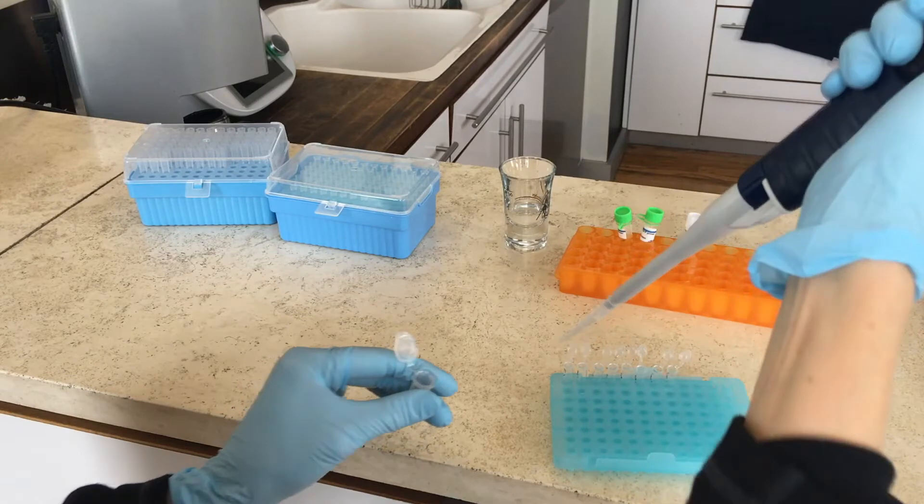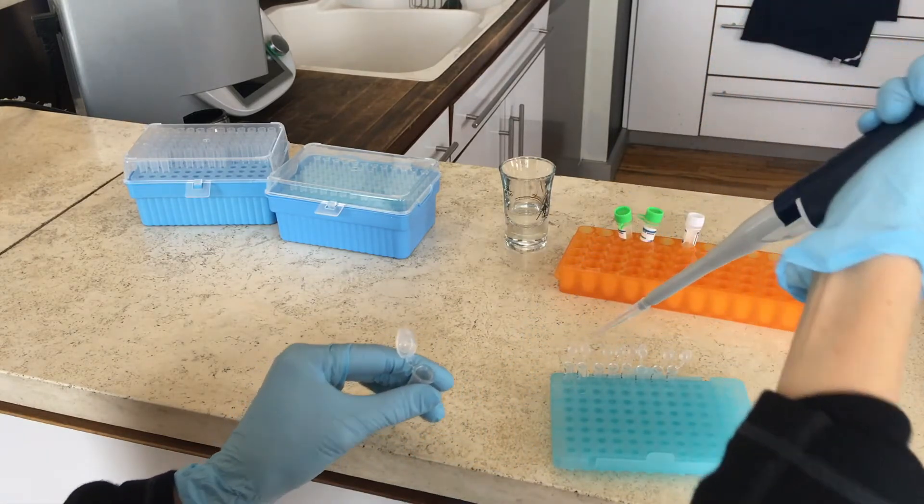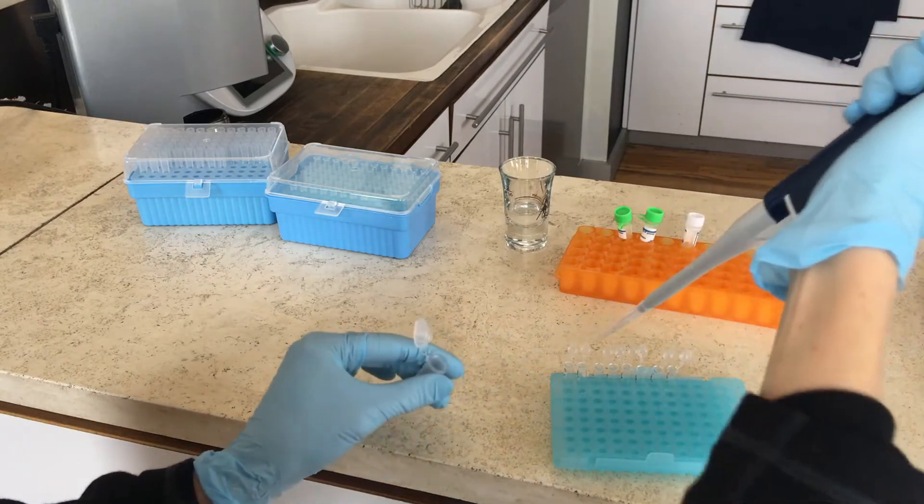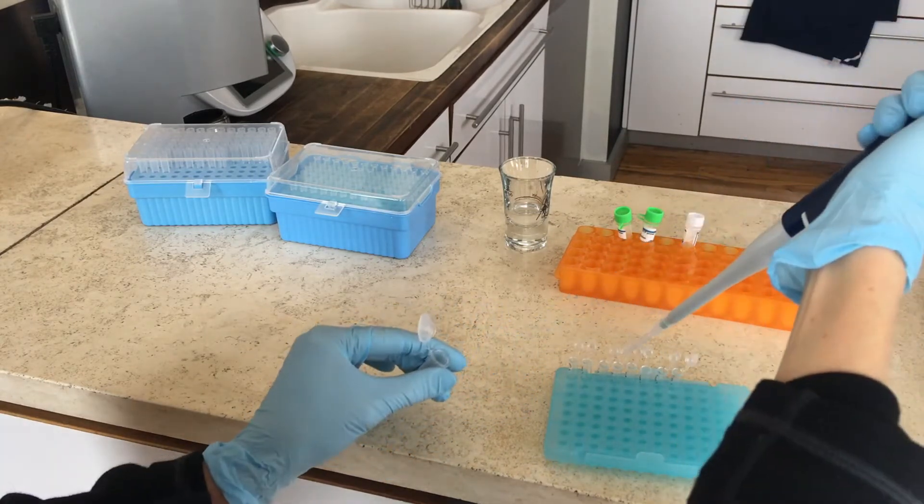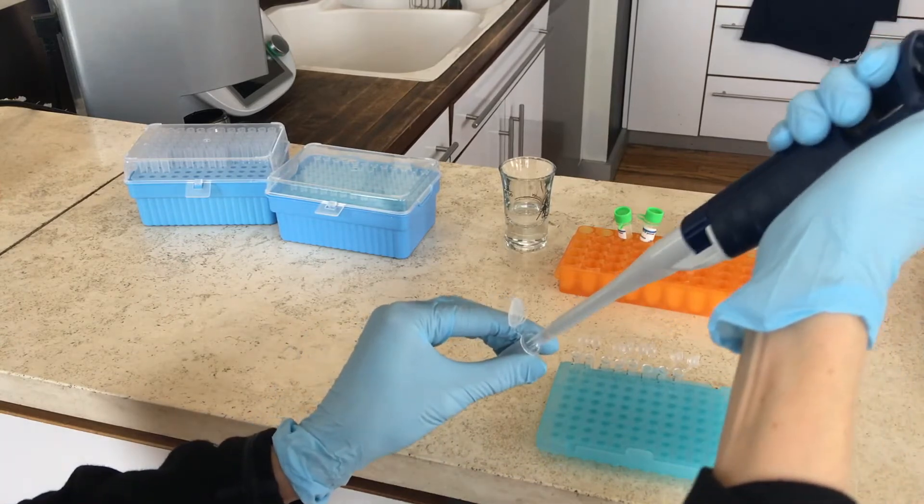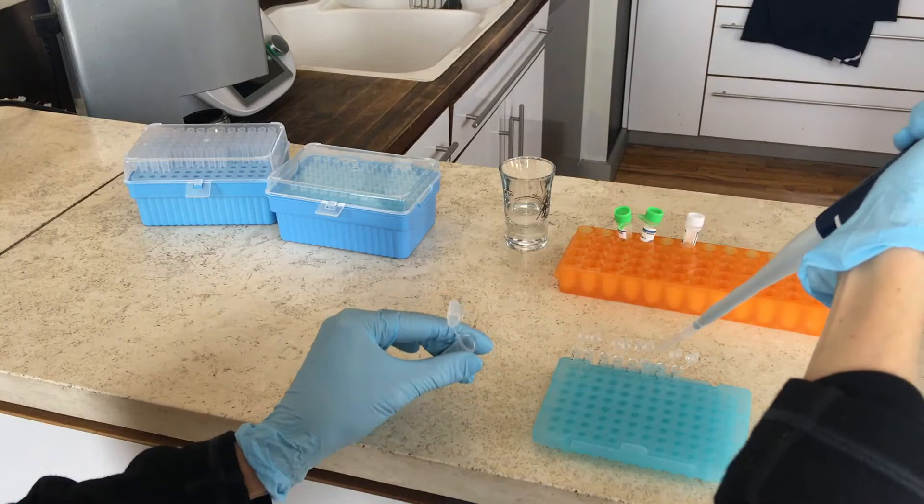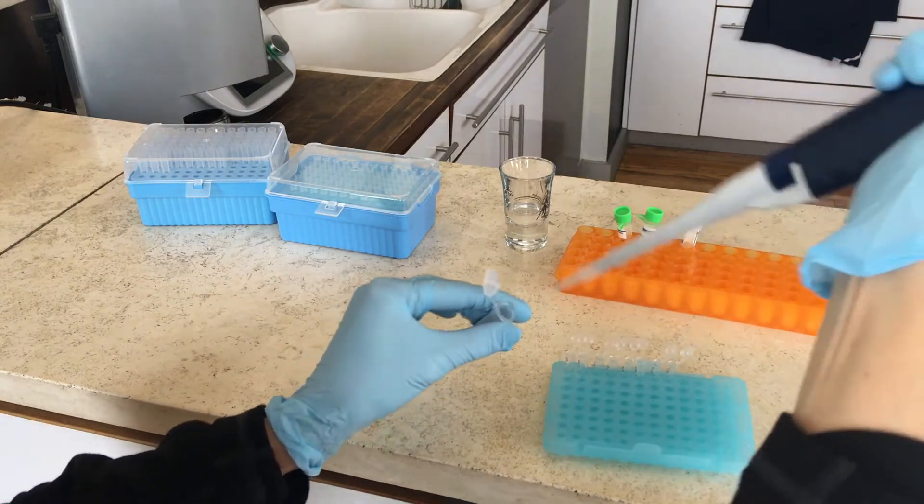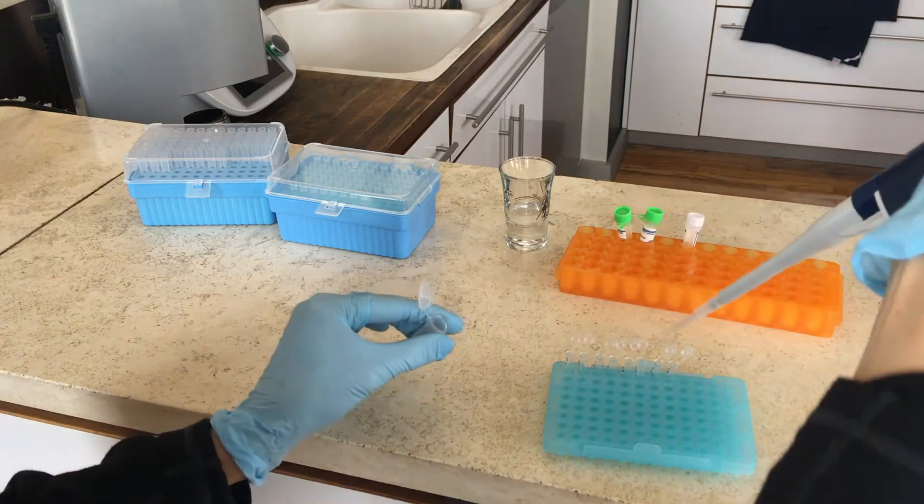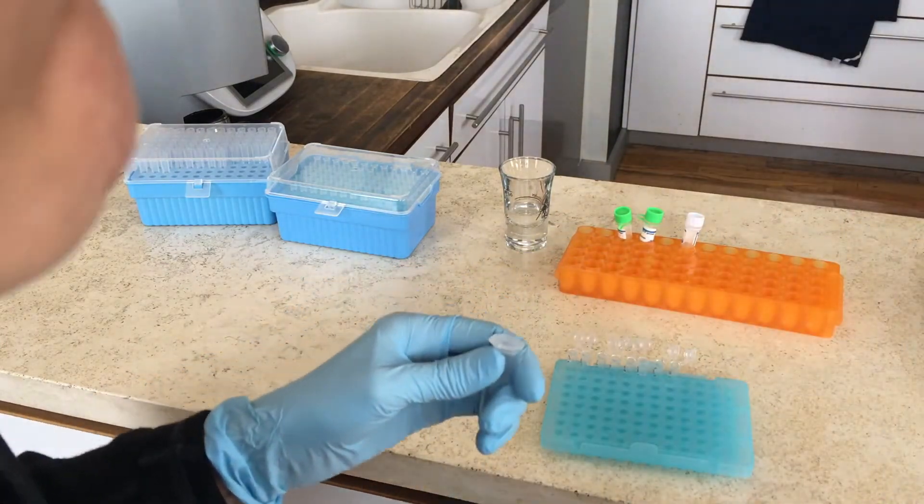You don't have to change a pipette tip between them because it's really just one liquid that you're distributing, so there's no risk of contamination. So we're going to do that, and there you go. And then you can get rid of that pipette tip.